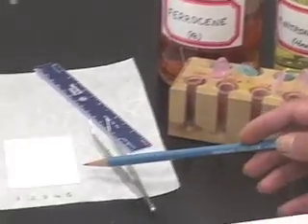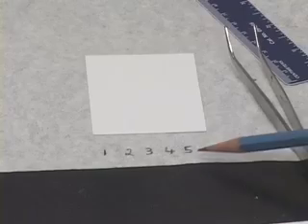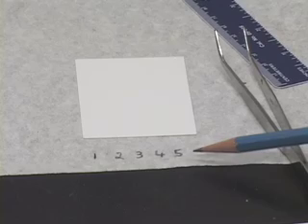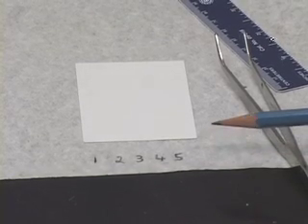I have taken a fresh TLC plate. You can use the same piece of paper, except this time these numbers will refer to a particular standard that you are applying on that spot.